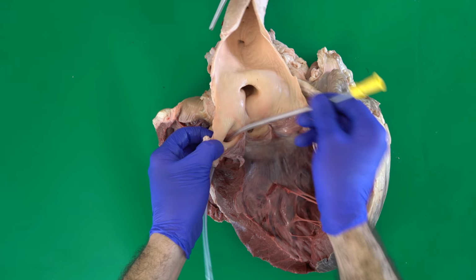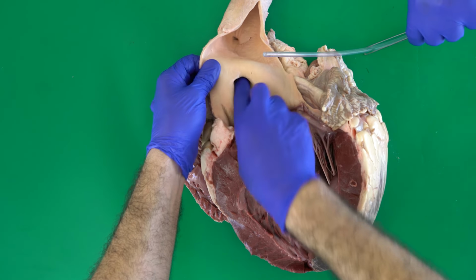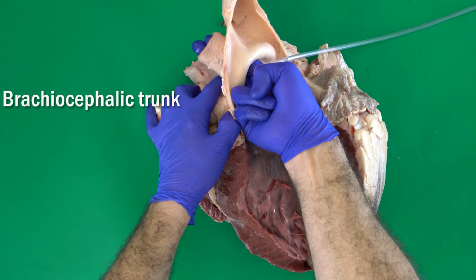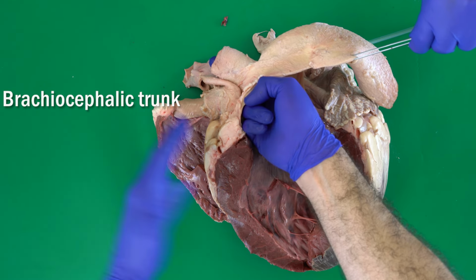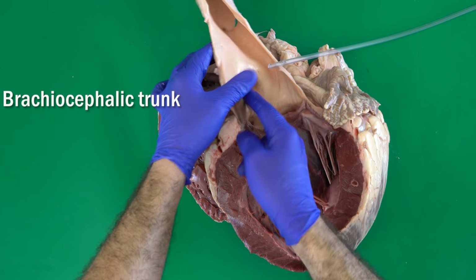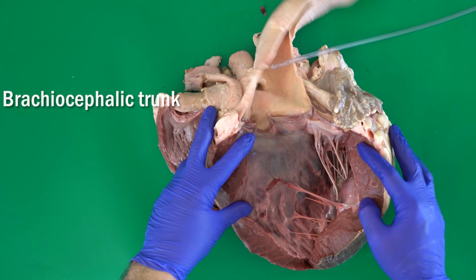Directly, if we follow the aorta here, after these two coronary arteries, we have this very big opening. Look, I can put two fingers here. Here we're talking about the brachiocephalic trunk. Brachio from brachium, for the forelimbs, cephalic for the neck and head. This is the brachiocephalic trunk, and after that it moves caudally to supply the rest of the organs and muscles in the body.